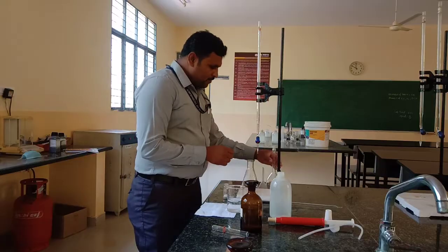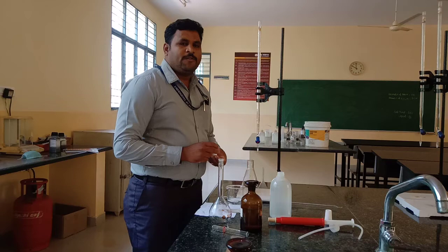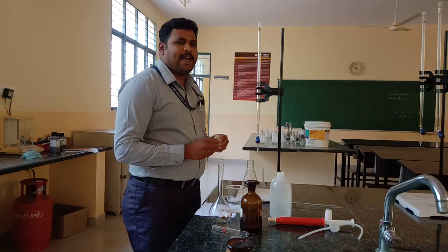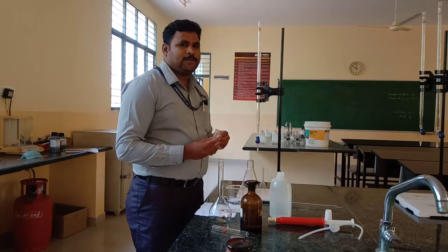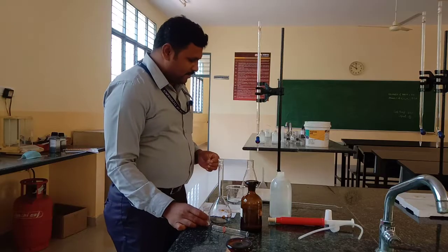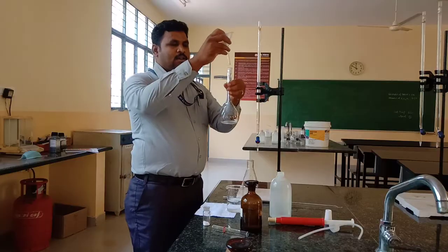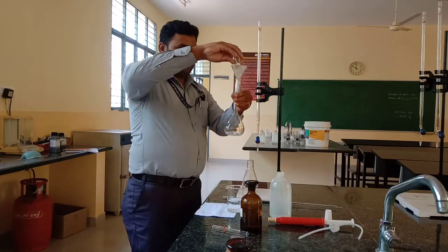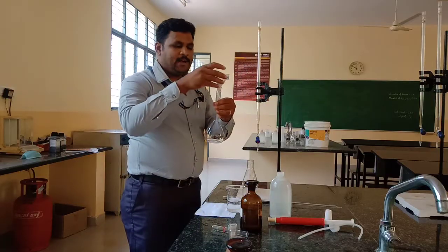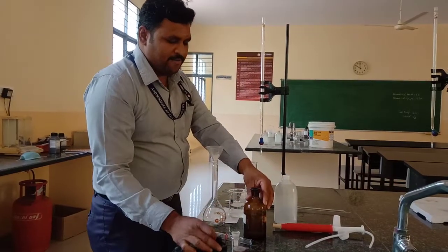Now we are going to prepare standard Na2EDTA solution. The full form of EDTA is ethylene diamine tetra acetic acid. Take out the Na2EDTA salt or crystals and transfer to the 250 cm³ standard volumetric flask with funnel. After transfer to the 250 cm³ standard volumetric flask, add 5 cm³ of ammonia.